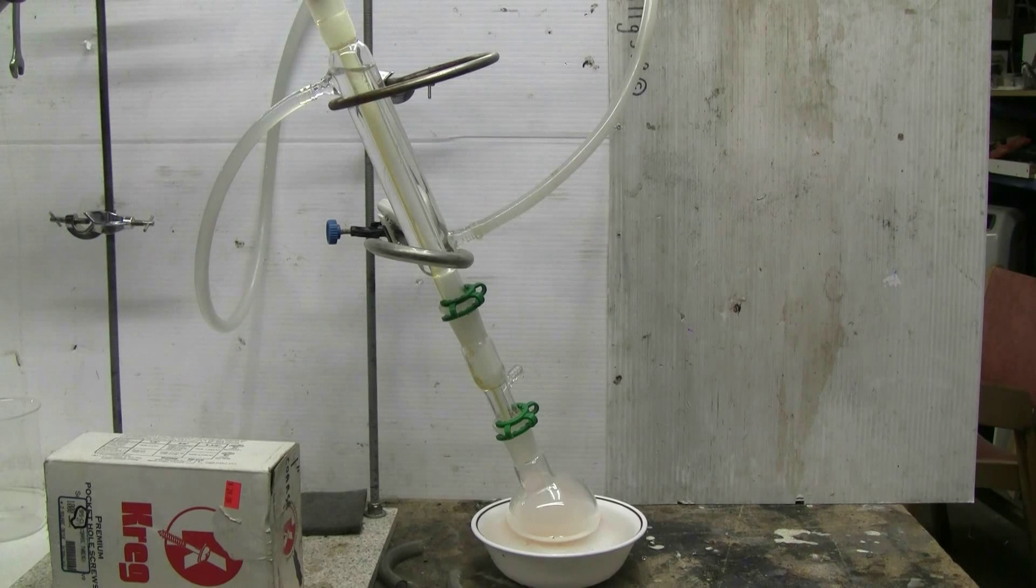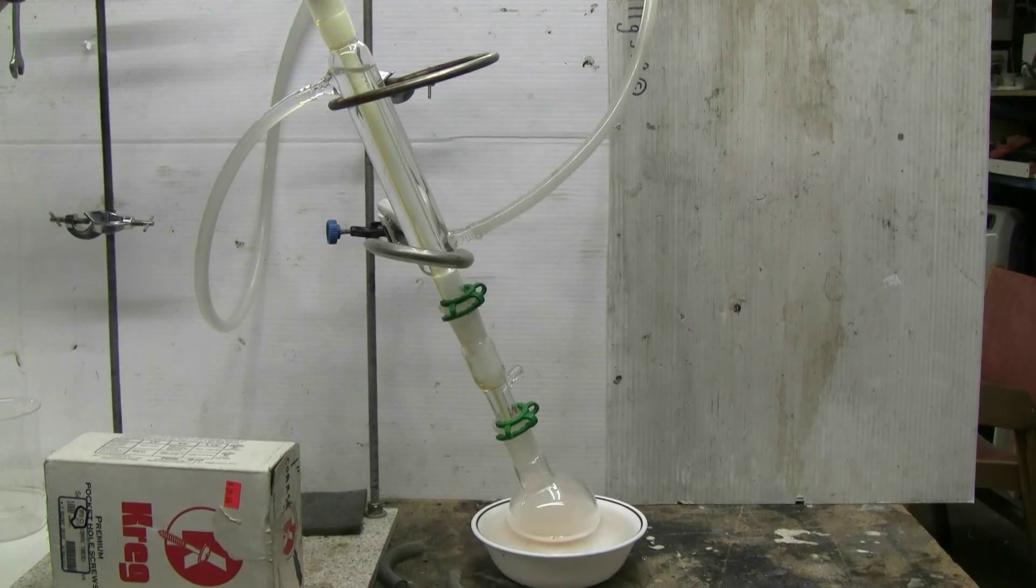I'm about 15 minutes in and the benzene is starting to come across at a fairly good rate. I've probably got not quite 100 milliliters yet in the collection glass, but I'm close.